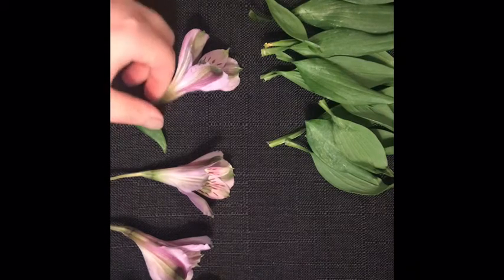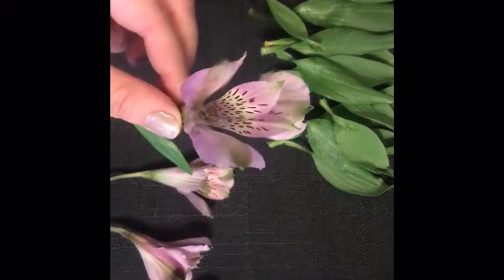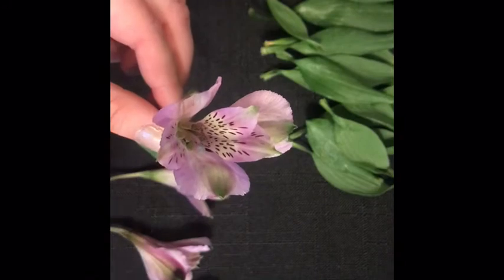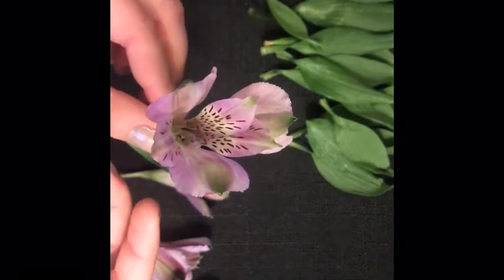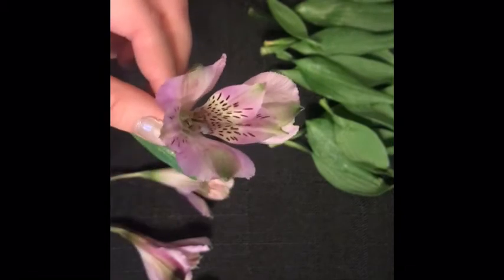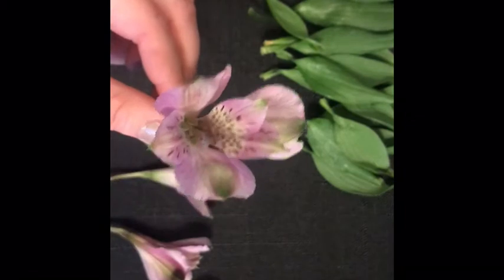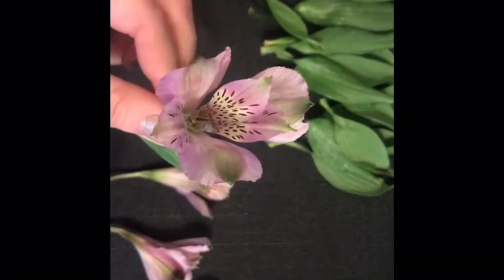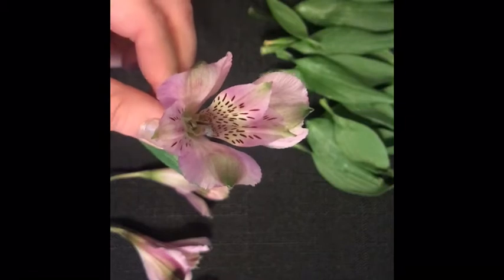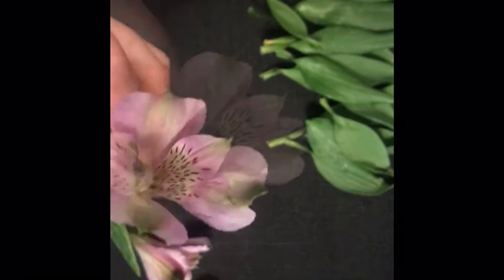So this flower has two parts, the male and the female parts, but they don't reproduce themselves and create genetically identical plants with their own genes. There are multiple parts in here that we're going to get to in a second that will help aid in having non-identical parent plants. So it's two strains of genetics coming together to create a new plant.